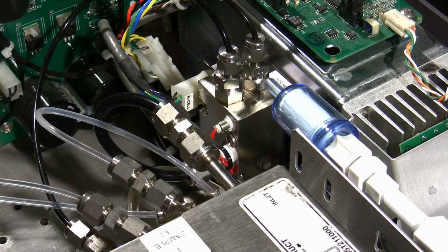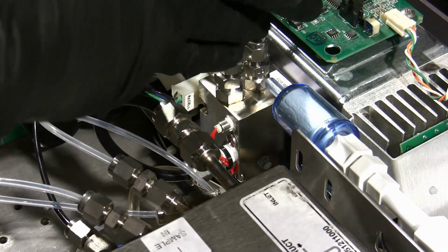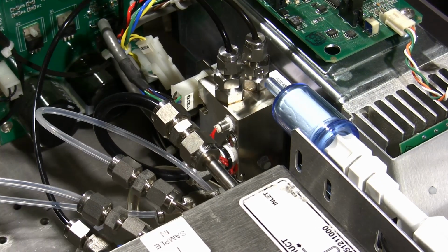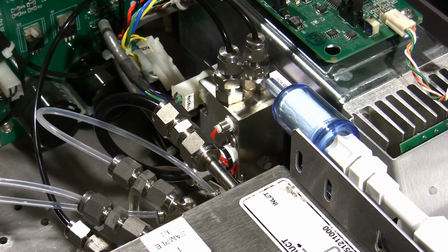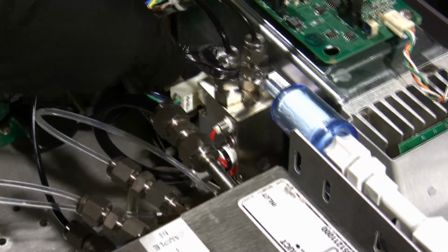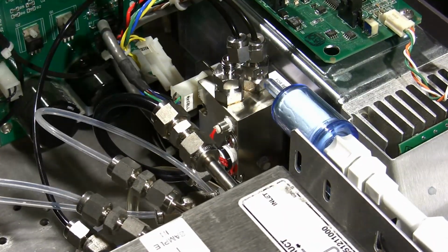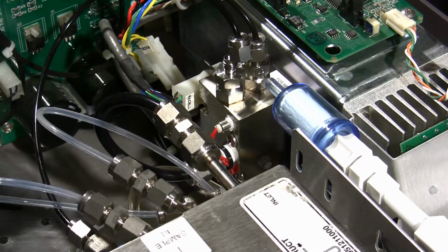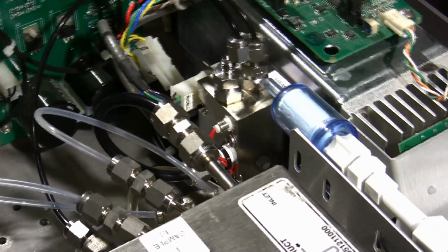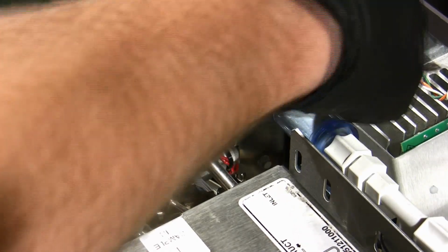Right here we'll see inside our reaction chamber is this section where the ozone and sample tubes go into our capillaries. It's mounted right onto the photomultiplier tube cooler here. I'm just going to start off by removing the things that are in the way of getting this out. So we'll take off our sample tube here. You can always tell the sample tube's coming from this mode valve, and if we follow the other capillary back, it's going to our ozone cleanser and then our ozone generator block. So that's an easy way to remember the order of where these go.